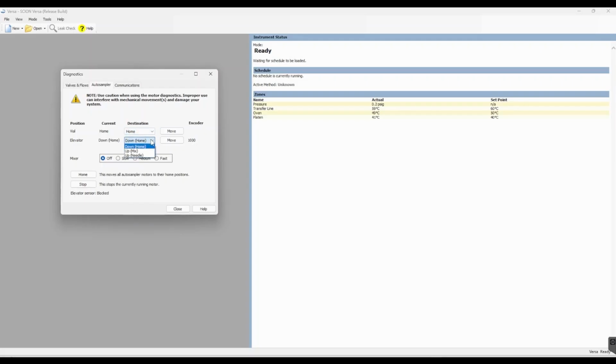And we have down, home, up, mix, up, needle under the elevator tab. We also have some mixer options here. We have the home button, which commands the Versa to move all the auto sampler parts to their home locations. And we have the stop button that stops the currently running motor. And then we also have the elevator sensor status.